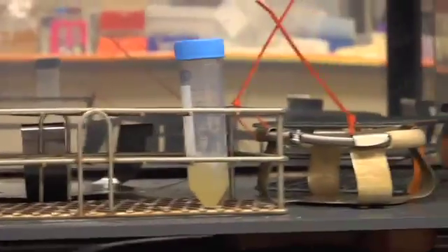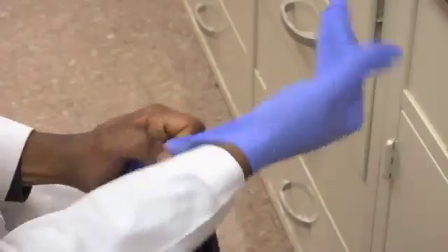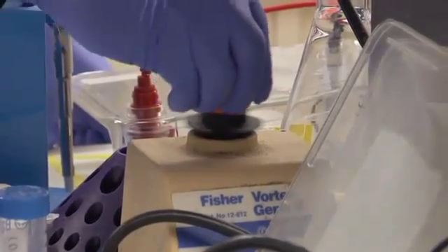The goal of this experiment is to grow Google. We do not know what it's going to look like once it grows out. Right now I'm going to color our bacteria the Google colors. The bacteria are incorporating these colors into their outer cell membranes, but probably into their entire cytoplasm as well.